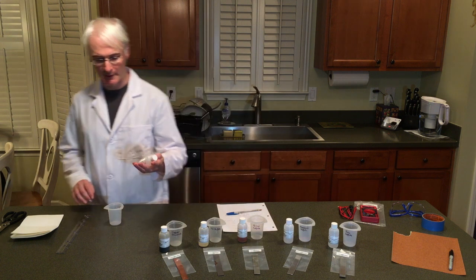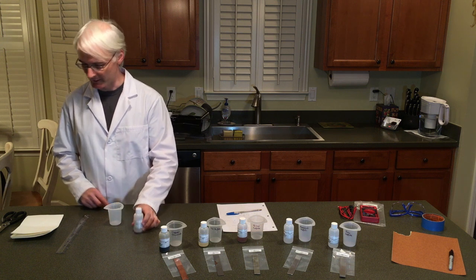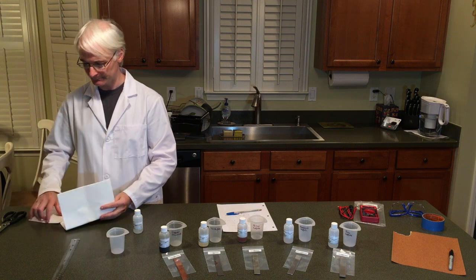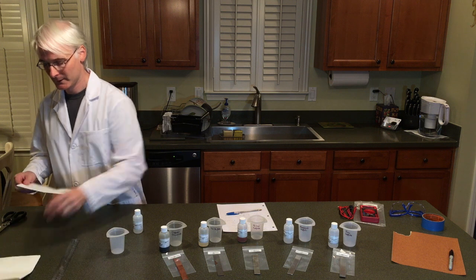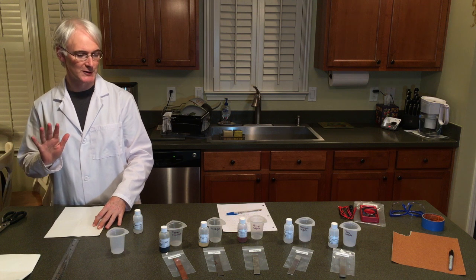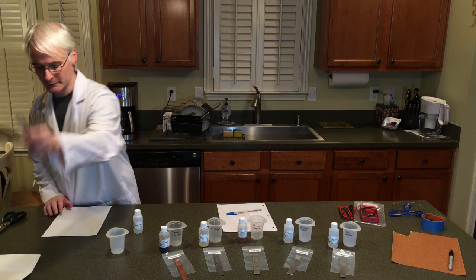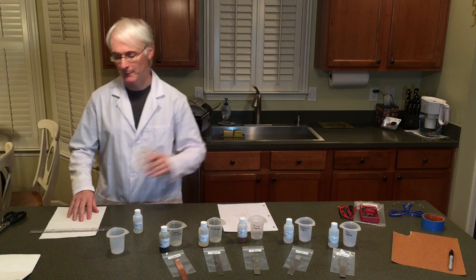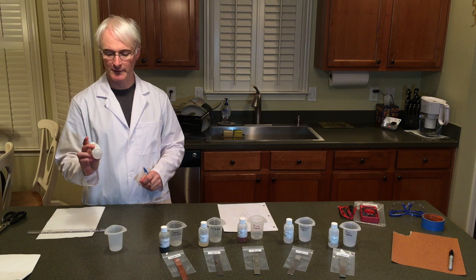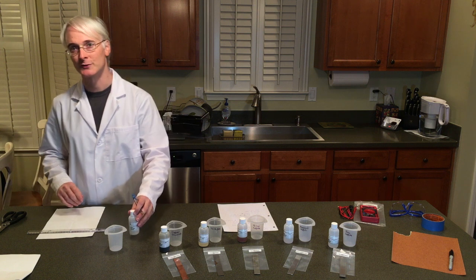First, over to our potassium chloride. This is going to be the solution we're using for the salt bridge. Take a piece of filter paper and make five salt bridges by cutting 2 by 15 centimeter strips of paper. Roll them up and then put them into the beaker with the potassium chloride. Give it a few minutes to soak up and that's your salt bridge ready to go.